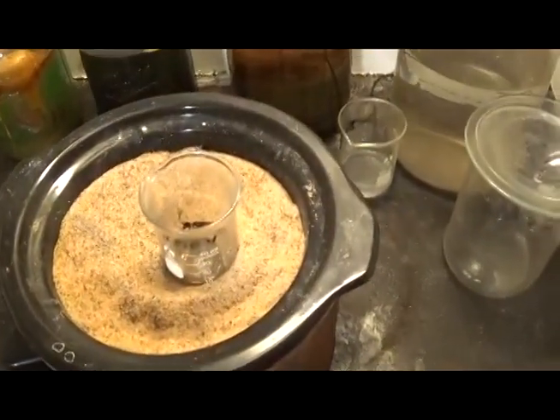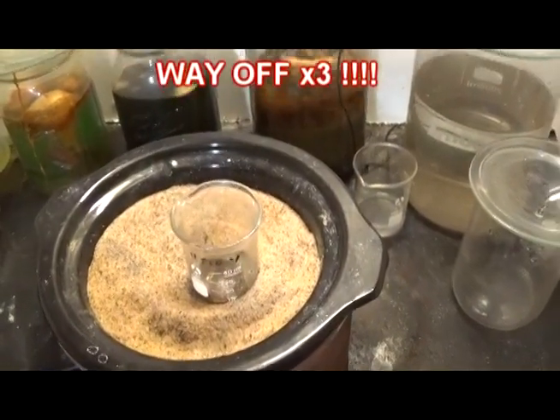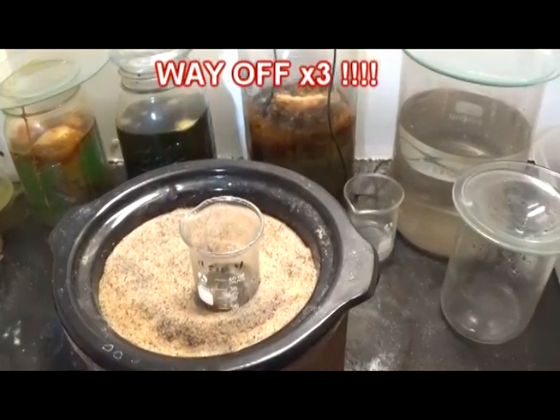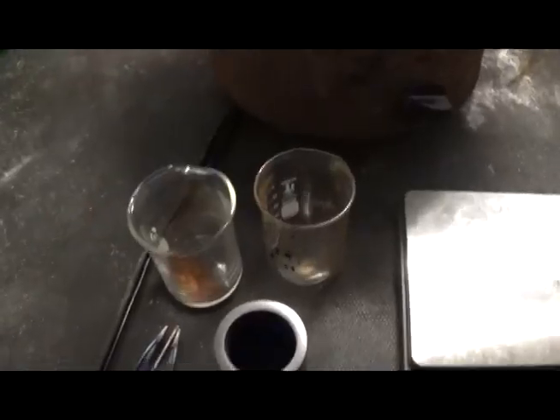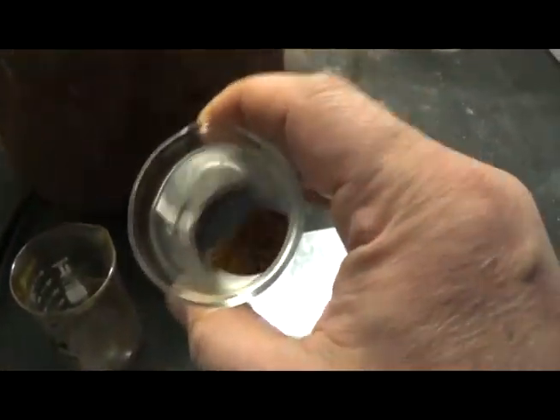All right. Once this dries out, we're going to get this in the furnace. Get us a nice little button, probably a gram and a half. Hammer it out. We'll stamp a nice cross in the middle of it. And there we go. All right. We are all dried out. And that's some good looking gold right there. That's some nice, nice looking gold.